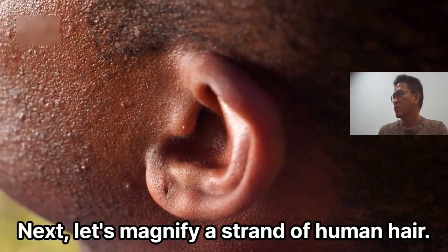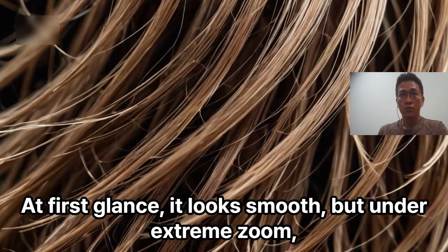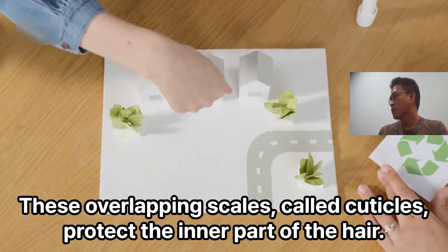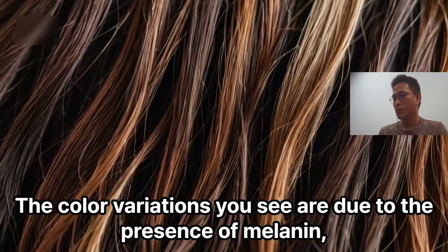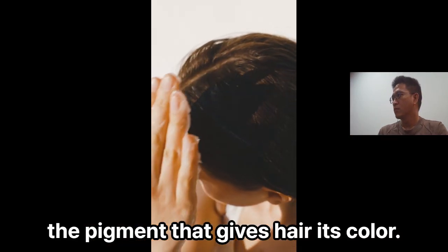Next, let's magnify a strand of human hair. At first glance, it looks smooth, but under extreme zoom, you'll see a scaly surface like shingles on a roof. These overlapping scales, called cuticles, protect the inner part of the hair. The color variations you see are due to the presence of melanin, the pigment that gives hair its color.